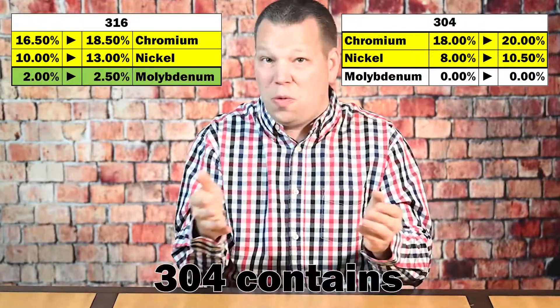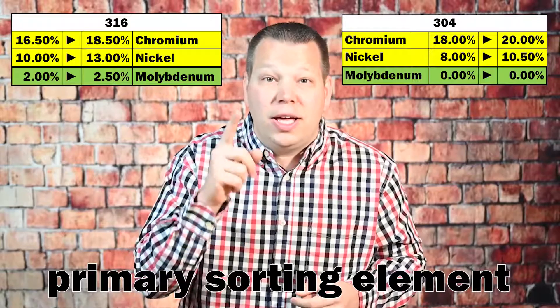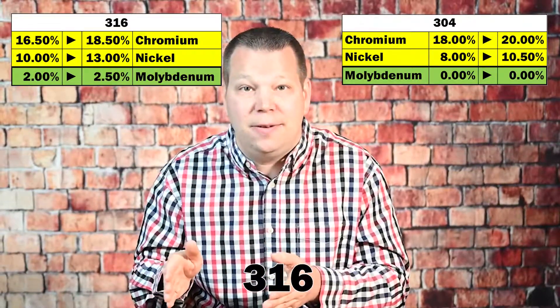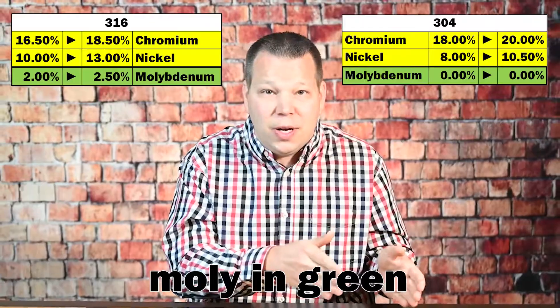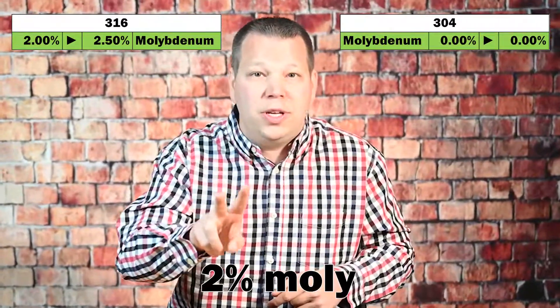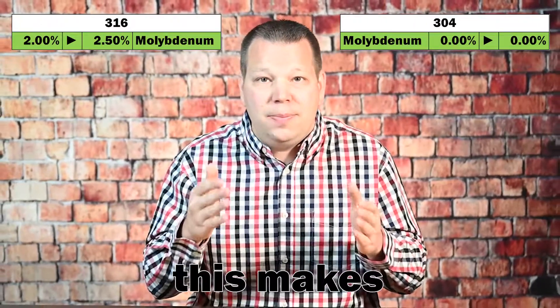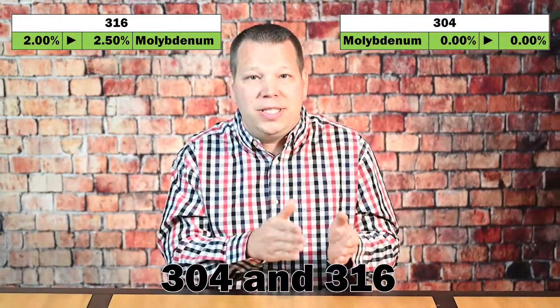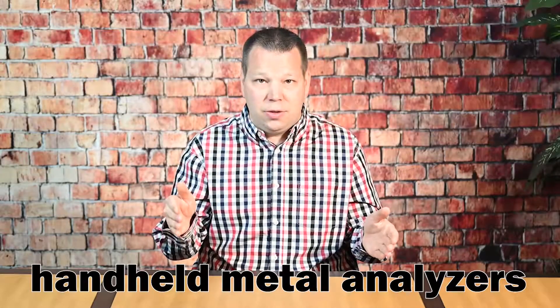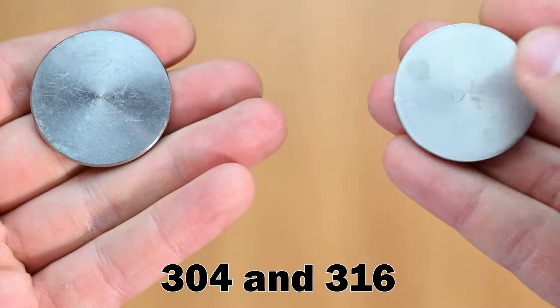Notice how 316 contains two percent molybdenum where 304 contains none. Molybdenum is your primary sorting element when sorting 304 and 316, so let's highlight molybdenum in green. We are essentially looking for about two percent molybdenum versus the absence of molybdenum in 304. This makes 304 and 316 easy to identify and sort for most handheld metal analyzers.